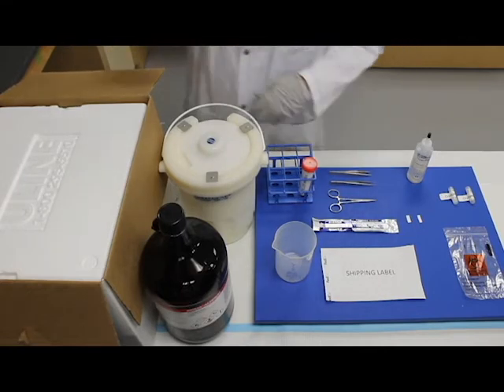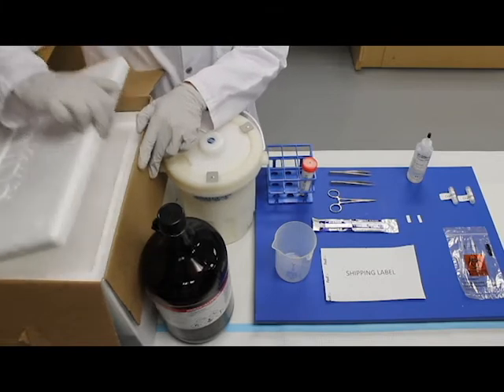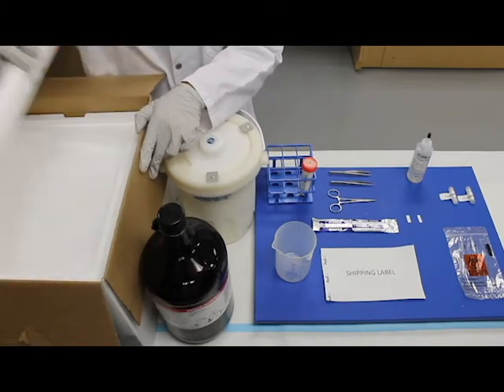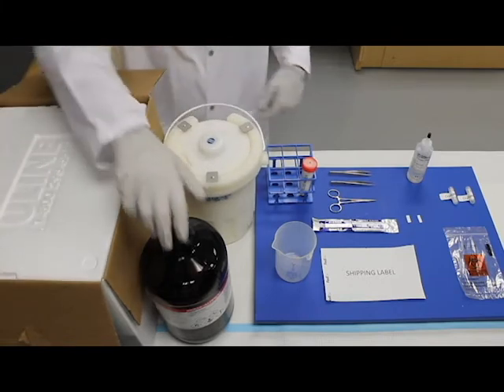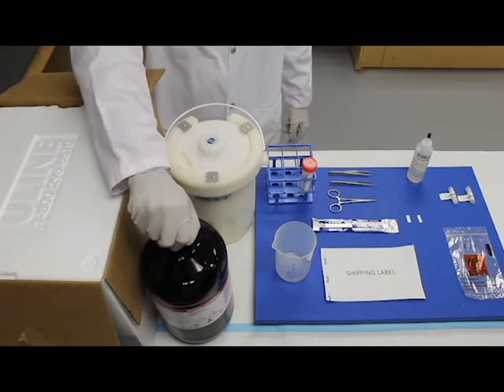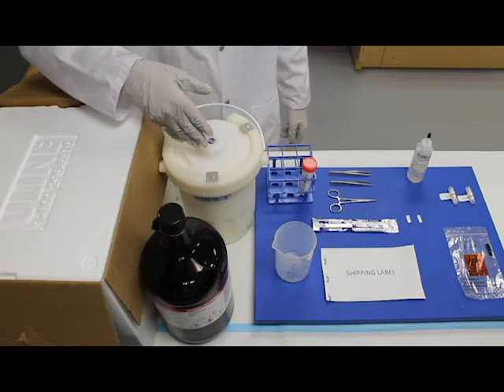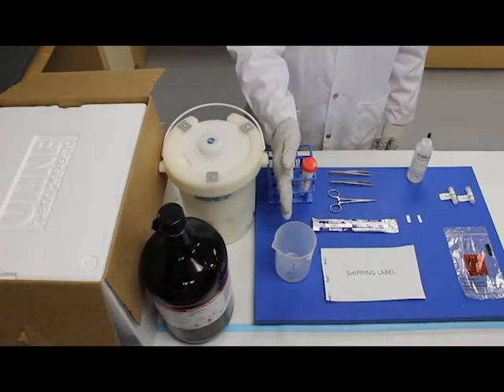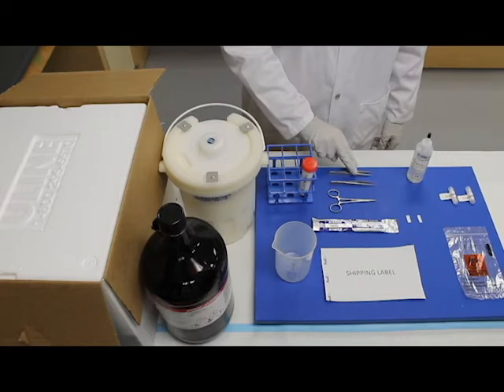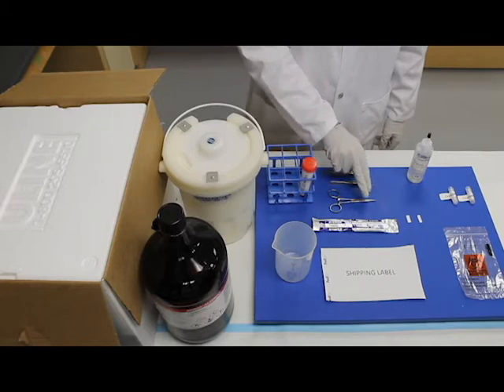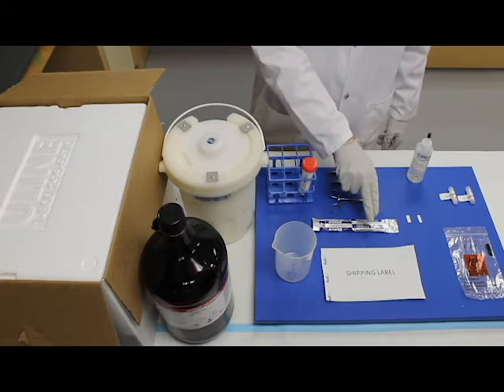In addition, you will also need 15kg of rice-sized dry ice, 500ml of isopentane, liquid nitrogen as well as a 1L Nalgene container or similar to contain the liquid nitrogen, one 500ml plastic beaker to hold the isopentane, one pair of forceps, one hemostat, one scalpel, and distilled water.